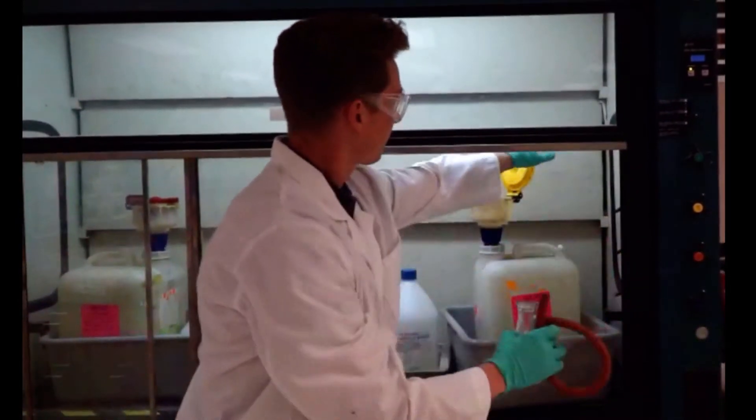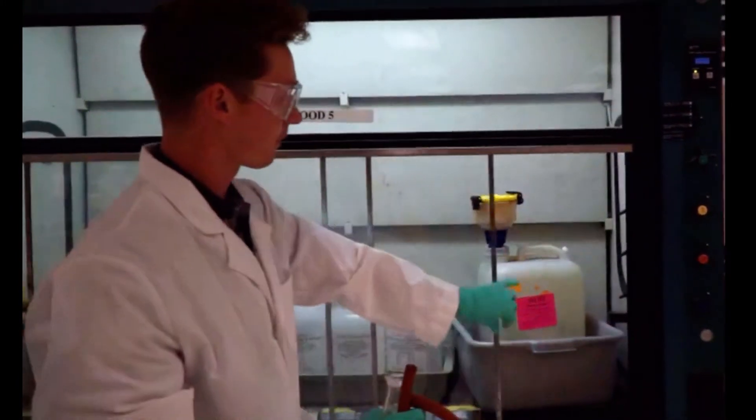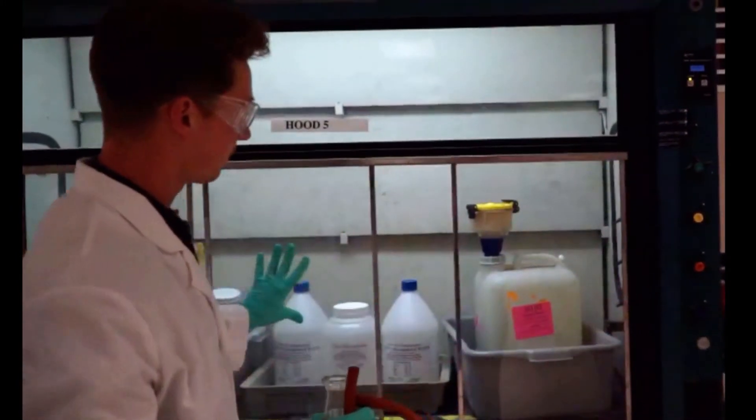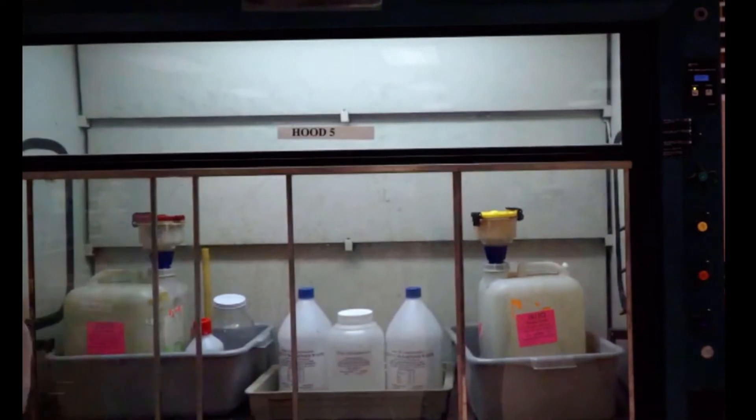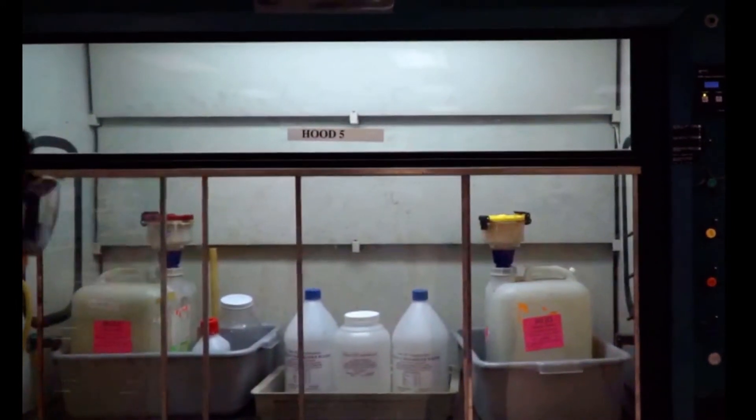Always close the waste lid after each use. Please keep an eye on filtrate levels in your trap and filtration flask so that the liquid doesn't go into our house vac.